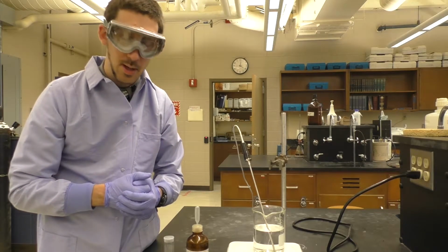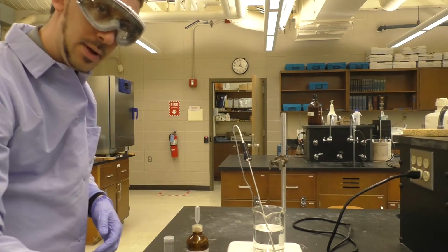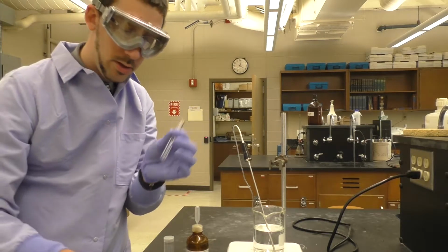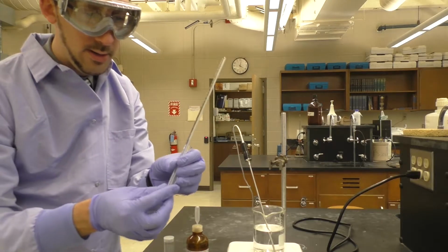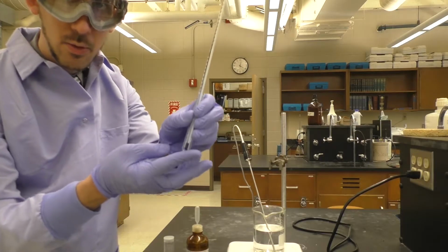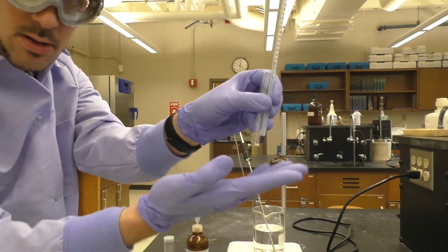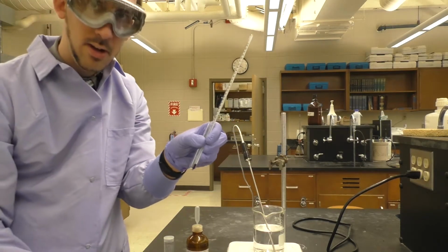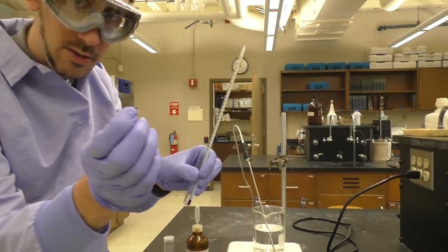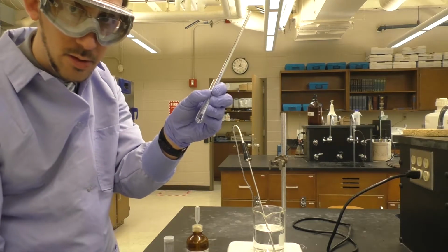So those are the pieces. How do we go about setting up the experiment? Well, the first thing we want to do is we want to rubber band your test tube to the thermometer itself. Now, you want the bottom of the thermometer to be level with the bottom of the test tube. So let's see if I can show you here. You want those two to be level. Now, how do you do that? You want to rubber band them together with a small rubber band, but you don't want to just hold them and try to do that. You're likely to break the thermometer.